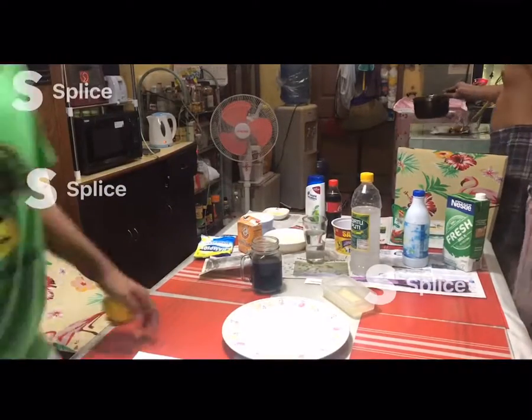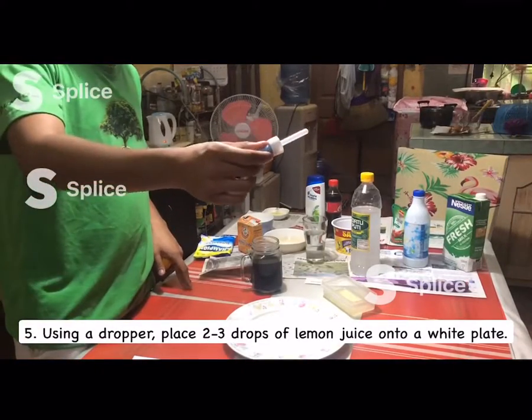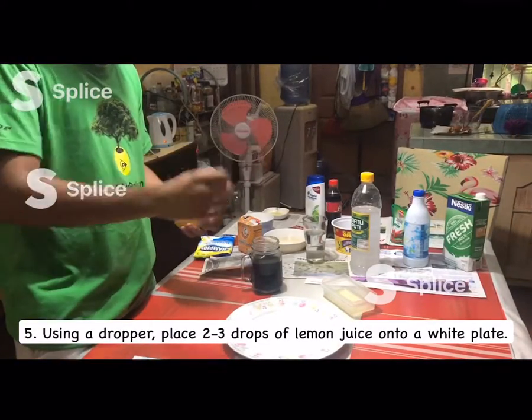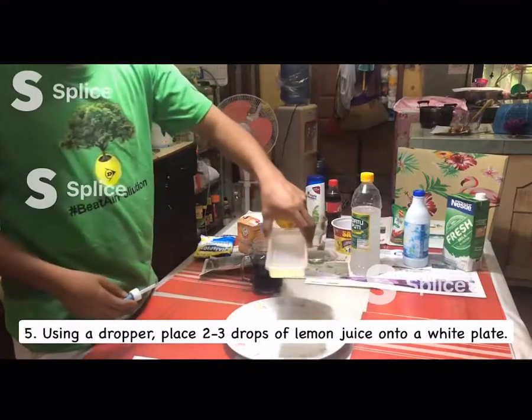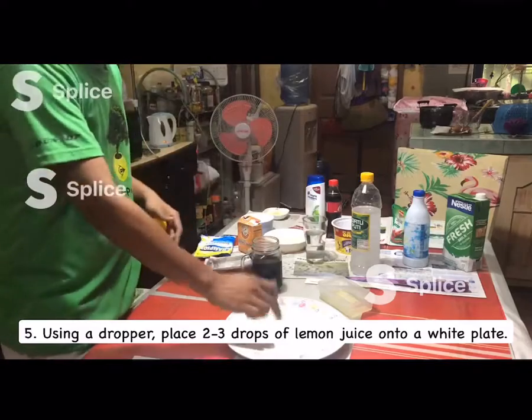Procedure number 5: using a dropper, place 2 to 3 drops of lemon juice onto a white plate.